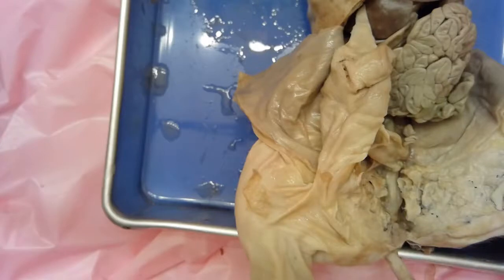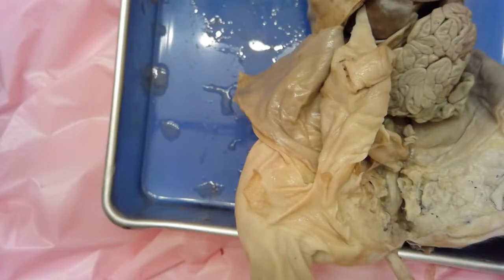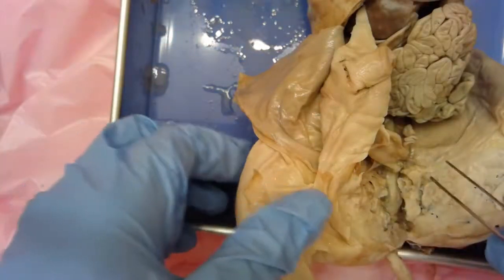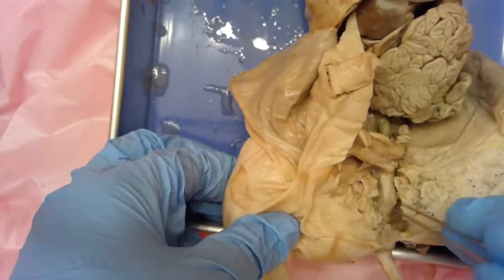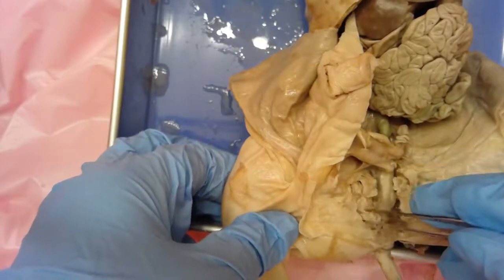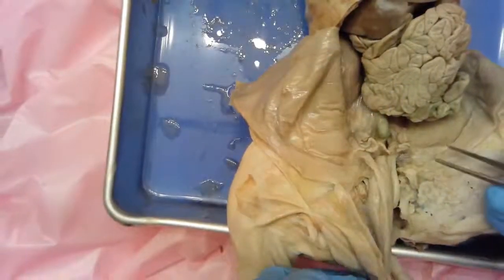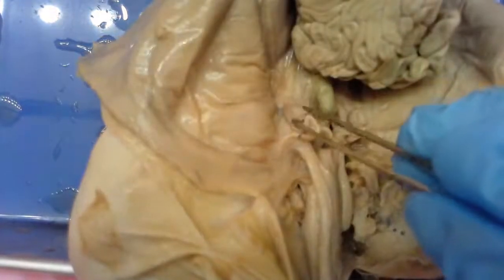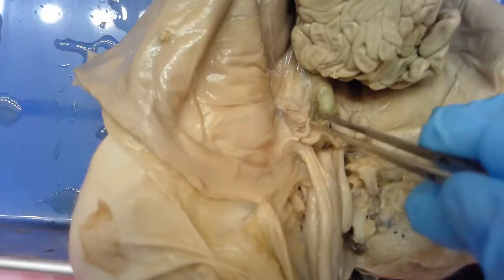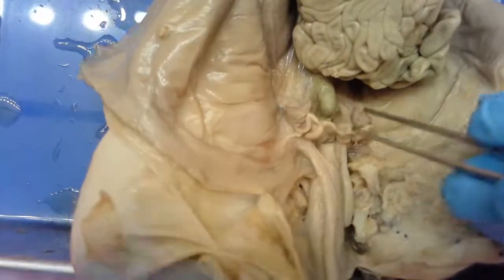We are back with our female specimen. I've already cut into the abdominal area - there's some bone here, and I had to cut through the pelvic bone to expose her reproductive organs. Let's start by looking in the abdominal cavity - I'll get a little closer so you can see these structures better. These two little oval-shaped structures are the ovaries, and this is where eggs are produced.